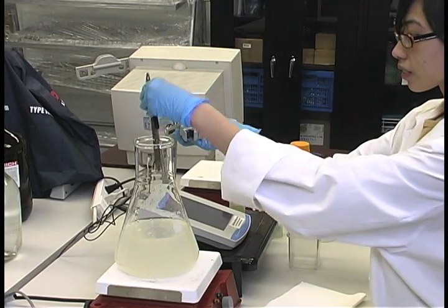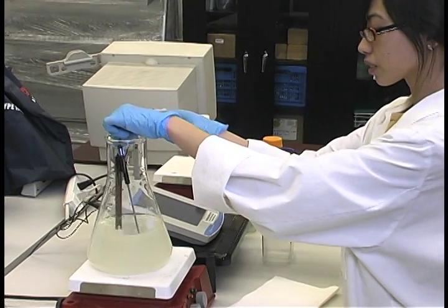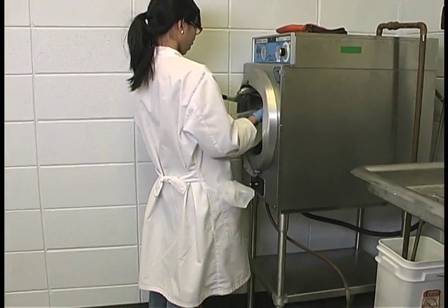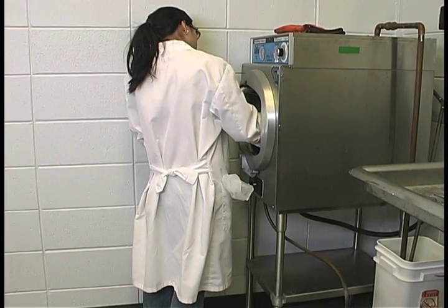This video will discuss methods for adjusting the pH of the media and different techniques for sterilizing the media. This video will also assume that you have an autoclave or pressure cooker for sterilizing the media.